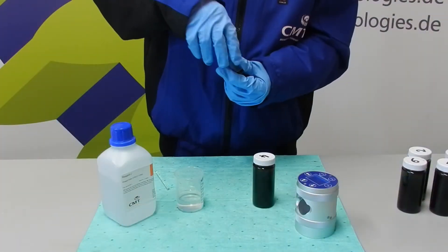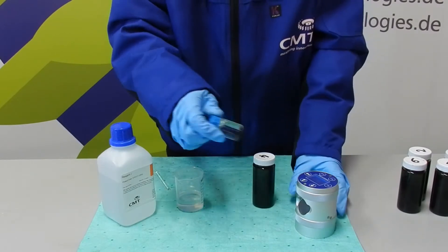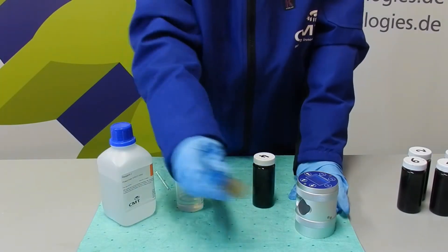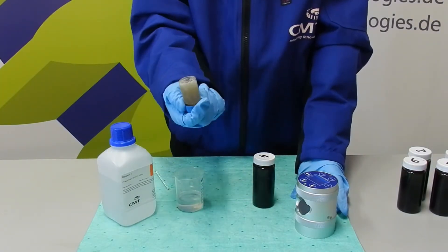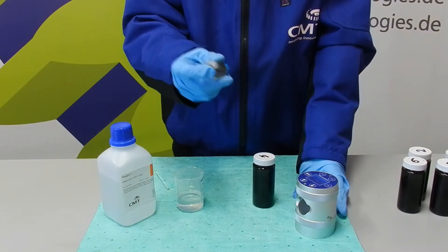Close the glass tube and shake it heavily. Ensure there is no visible oil left on the bottom of the glass tube.